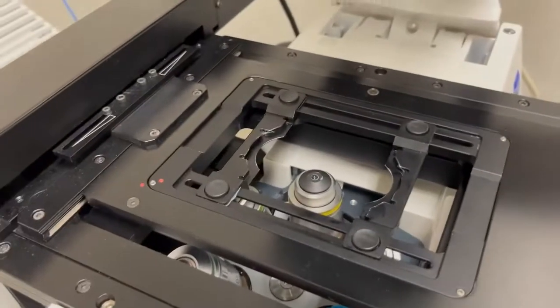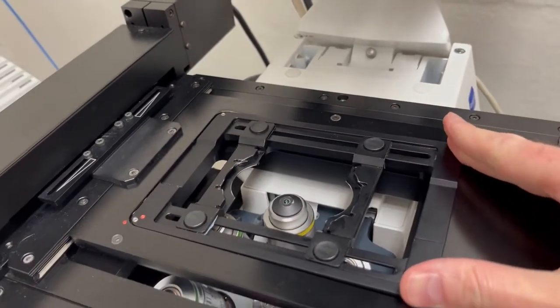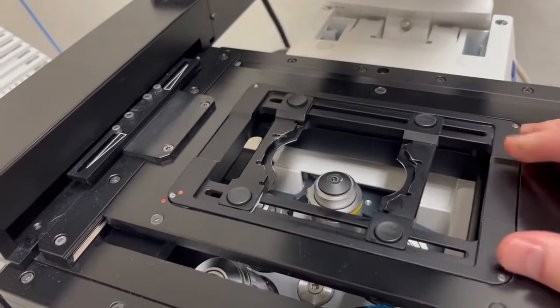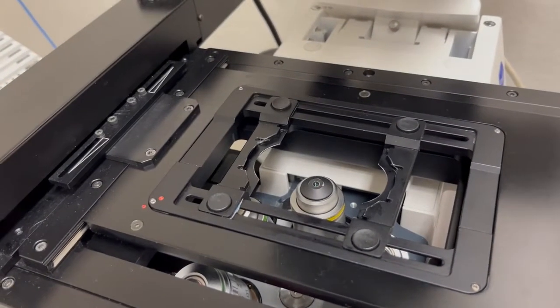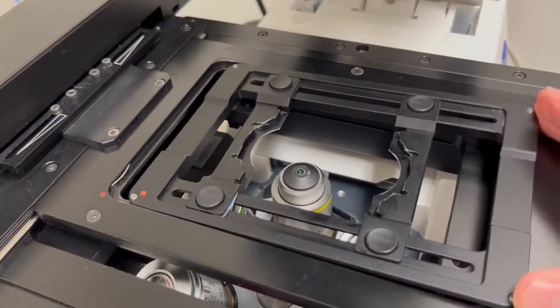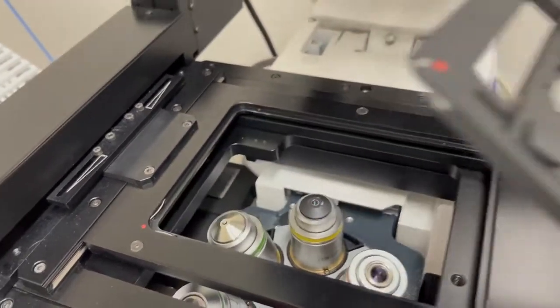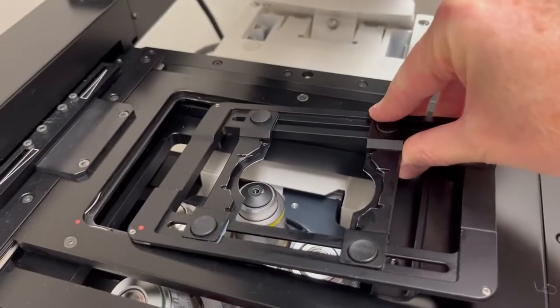And what you want to avoid is a situation where this is at an angle, so sort of like that, which will tilt your sample, or loose altogether. Okay? If those are the case, it's loose, it's at an angle, or it's dirty, you can remove it just by popping it out. So if it were in, we can remove it just by pulling on this. We can clean it if we have to, and then we'll put it back on by putting it here.